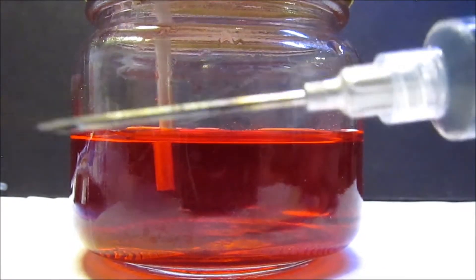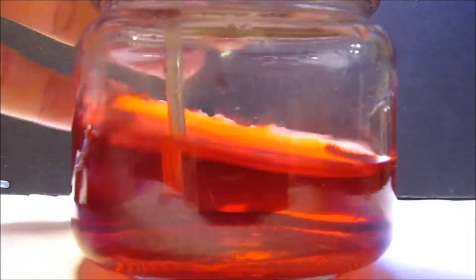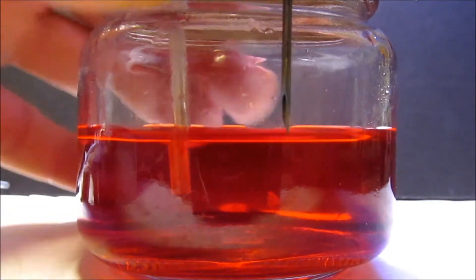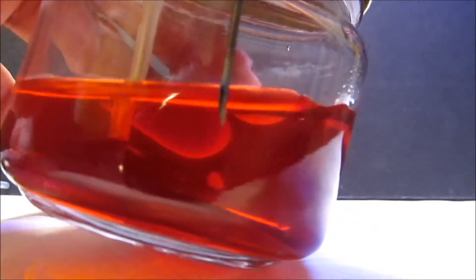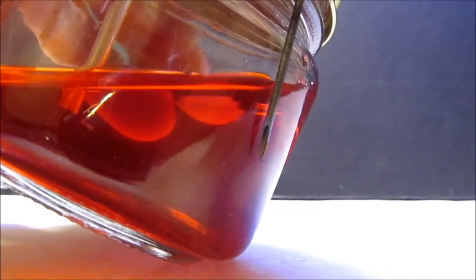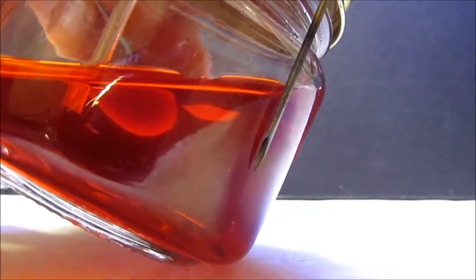Because with the regular lid, if you put the needle in there, it doesn't reach the material or the mycelium. So you have to tilt the jar and jack around with it to get it right. And then after you start drawing it out, you have to tilt it more and more.